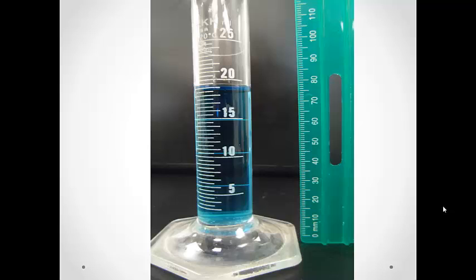The markings on the ruler are the same as on the caliper in that little individual lines are millimeters and the numbered lines are centimeter marks. Note that on this ruler, the numbers tell you the measurement in millimeters. To record the measurement in centimeters, simply move the decimal one place to the left.